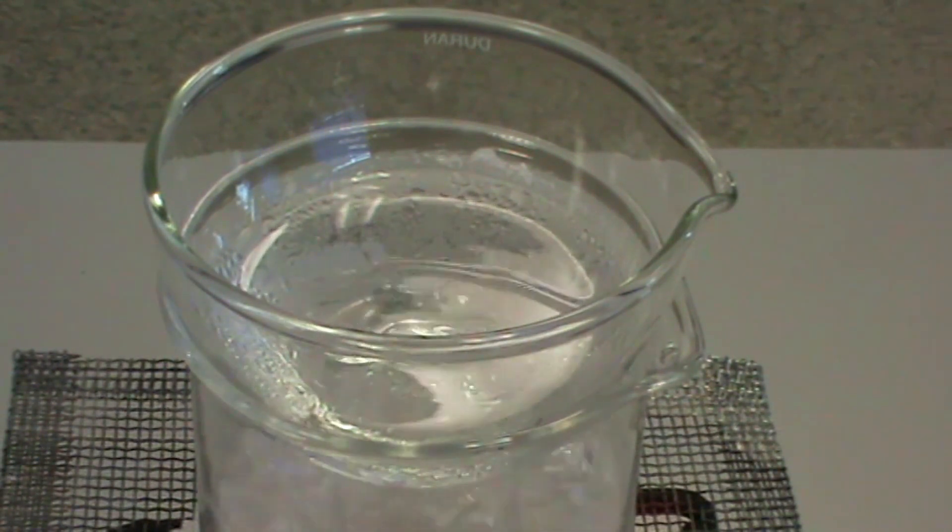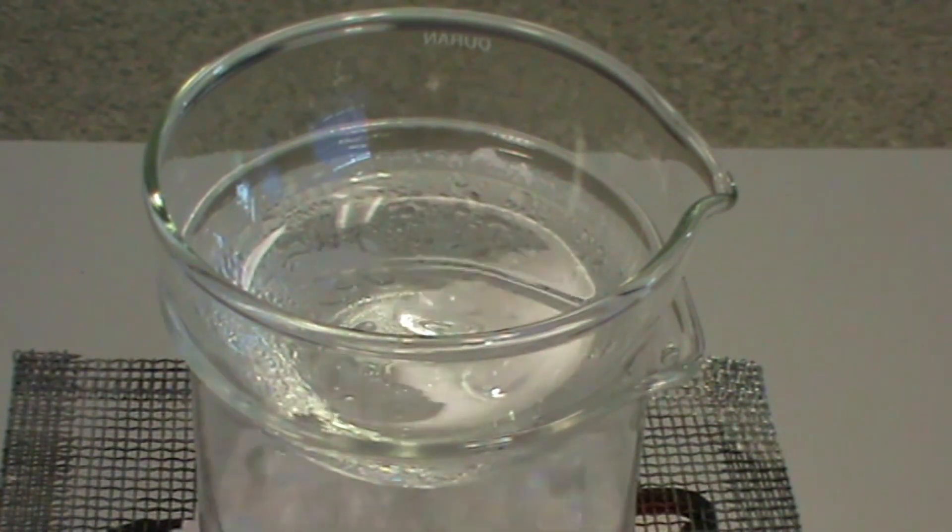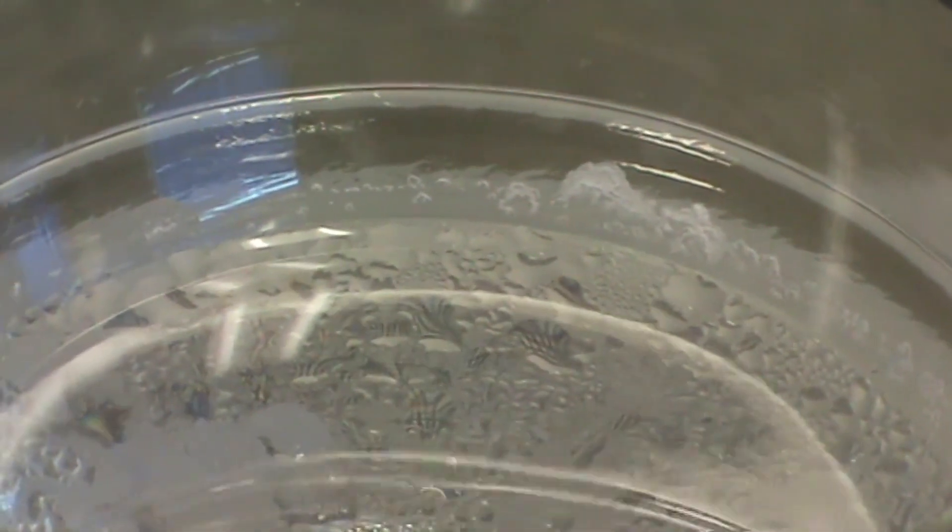The solution is then left to evaporate until crystals are seen to form in the evaporating basin. The basin is then left in a warm place for the remainder of the water to evaporate over time.